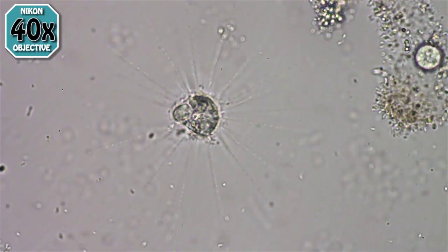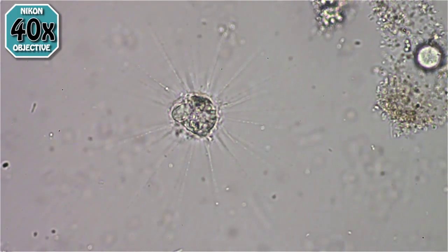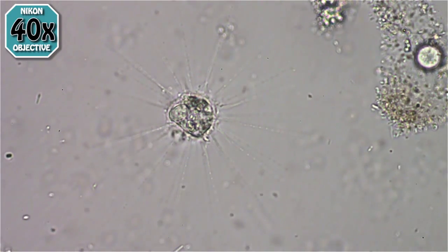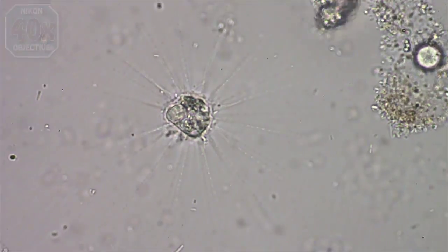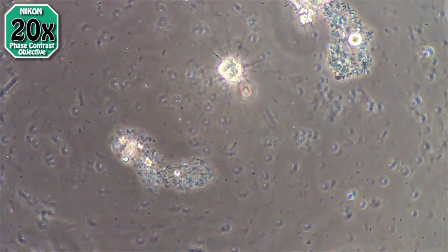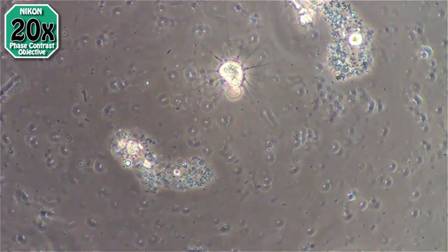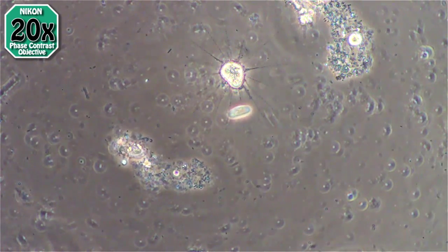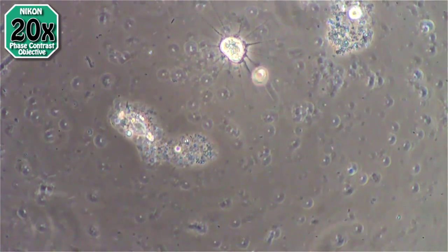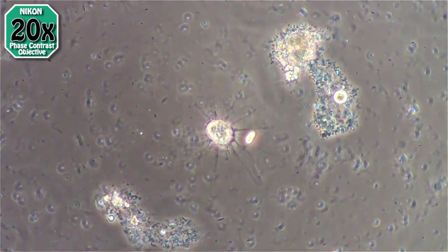On the left there it looks like some kind of vacuole forming, possibly expelling some digested ciliate, which we'll see another one of soon. Here let's go to 20x phase contrast. The reason this looks so weird is because I have lowered the phase contrast condenser to give it more contrast — almost an oblique effect.